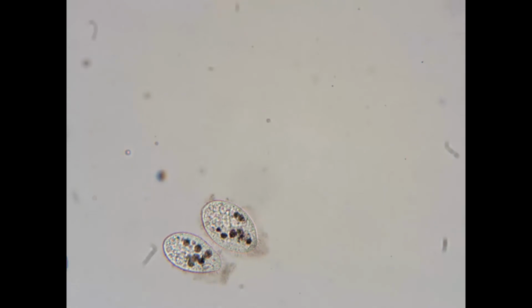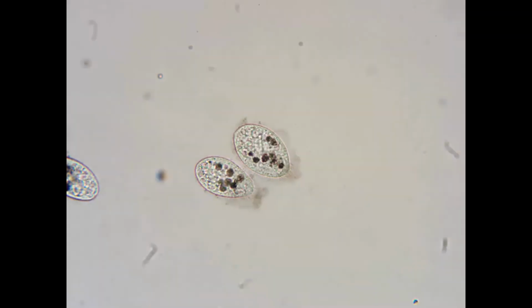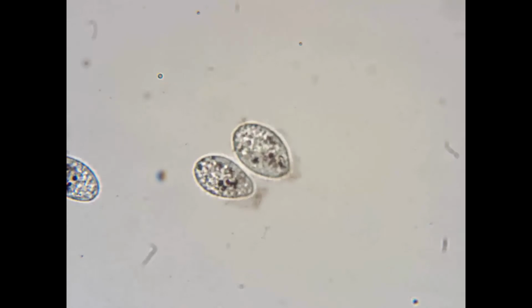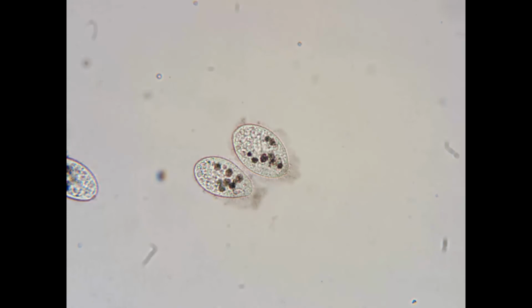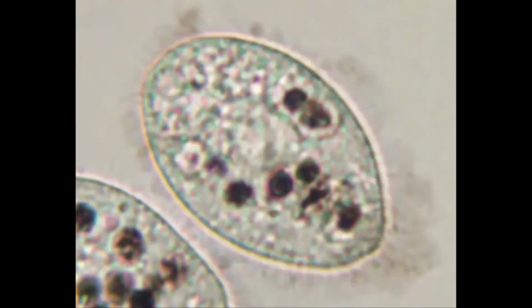Let's center these cells one more time. Play around with the fine focus here. It's important to remember the tetrahymena are 3-dimensional, so different parts will be in focus at different times. I'm trying to find a nice focus where all the vacuoles can be seen. This looks pretty good. Let me take a picture, crop the cell, and digitally enlarge on the screen. Now it's time to count the vacuoles. I would say there are 8 in this cell.